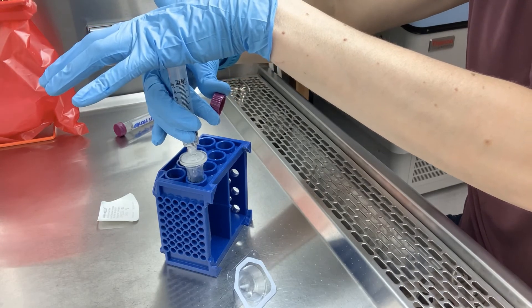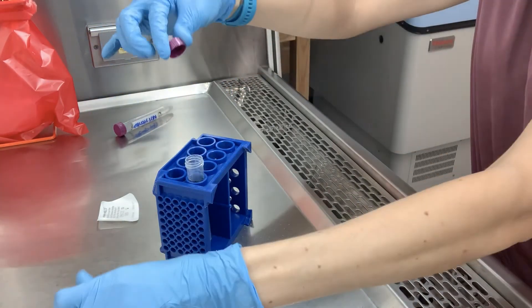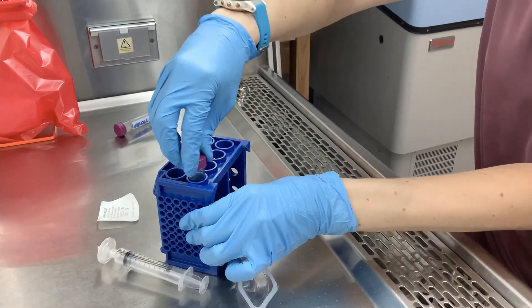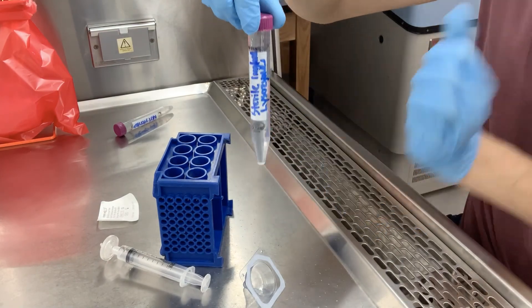You can see the dripping falling in at a very steady rate — not a constant flow, but just drip, drip, drip, really steadily. You don't want to apply too much pressure or you risk breaking the membrane of the filter. Now we have our sterile solution and we're ready to go.